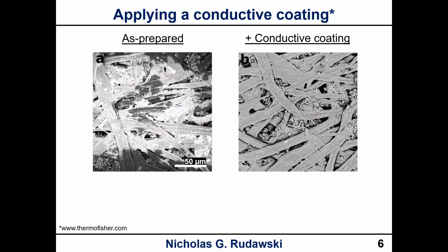Here's another example of this. So same idea. On the left, you have an as prepared specimen, right? And you see the same things. So we see a lot of signal clipping, right? Saturation of signal. And then we apply the conductive coating and it goes away, right? And we can see much better detail in the image as well, right? So in the areas where you have all this saturation of signal, it becomes really hard to actually pick out what's there, okay?